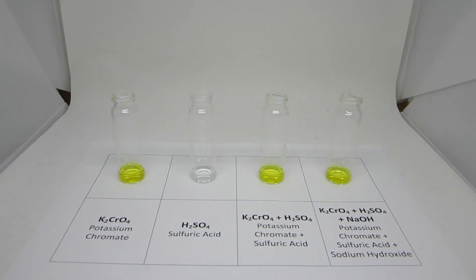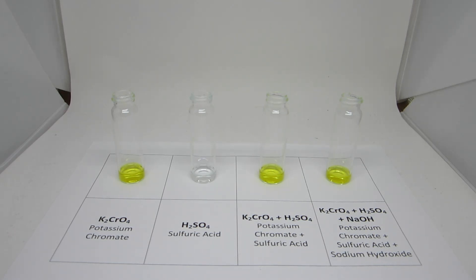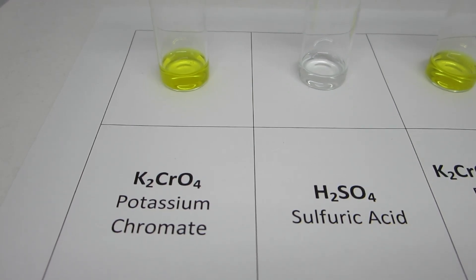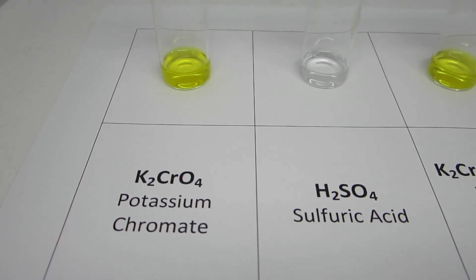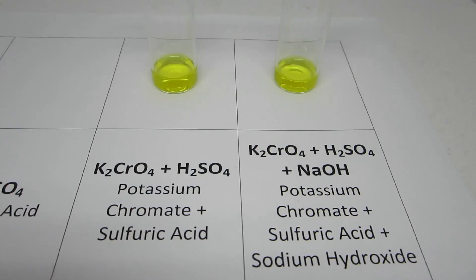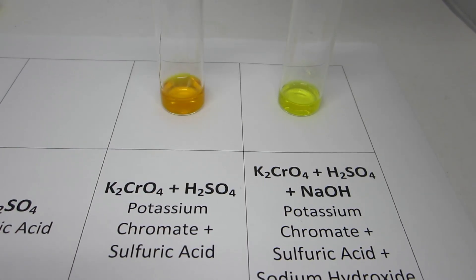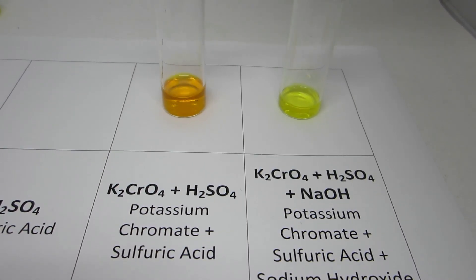The first equilibrium reaction involves the equilibrium between chromate and dichromate ions. This reaction will involve mixing potassium chromate, which is yellow, and sulfuric acid, which is colorless. Upon mixing, the sulfuric acid reacts with the chromate ion to form the orange dichromate ion.